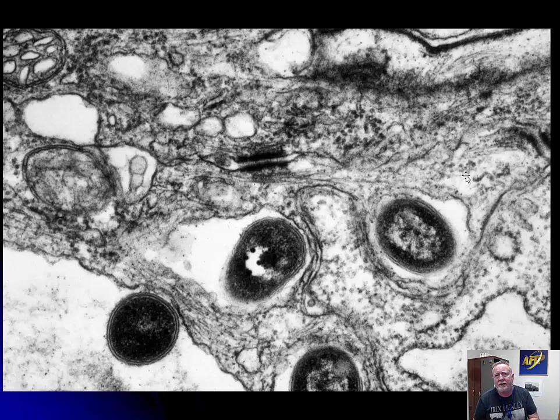Lower vertebrates like fish and reptiles can form desmosomes between macrophages, between histiocytes. They can have desmosomes on the macrophages. This is a granuloma. This is the wall of a granuloma. And remember, we use granulomas when we want to wall something off and not let it get into the rest of the body. And so lower vertebrates have developed the ability to put down intermediate filaments in their macrophages to create an even more impenetrable barrier.